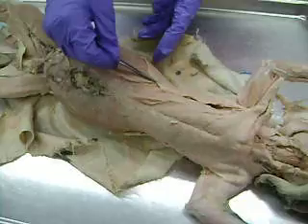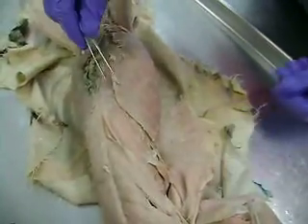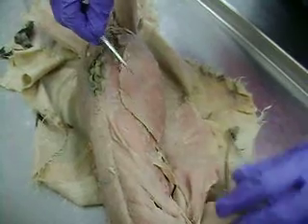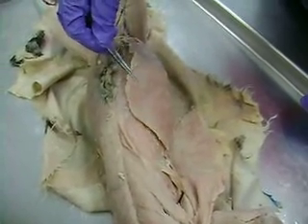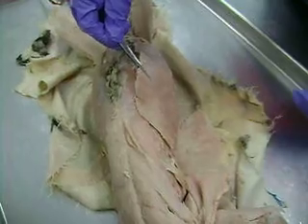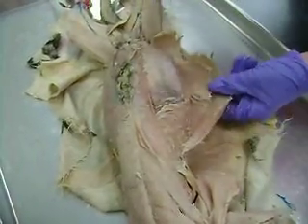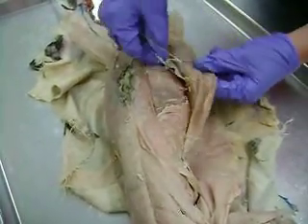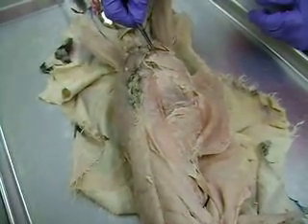As we continue down the body of the cat, this is latissimus dorsi, and I'm just going to flip that back out of the way so that you can see here in the abdomen. This is external abdominal oblique, and as we pull that back, this would be internal abdominal oblique.